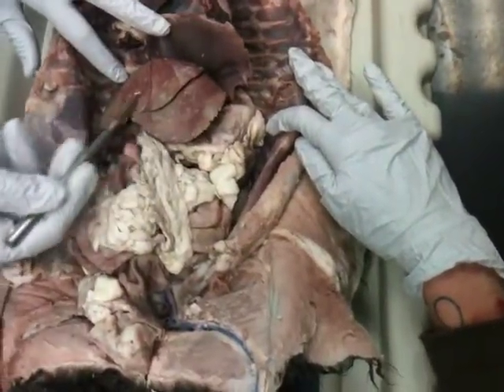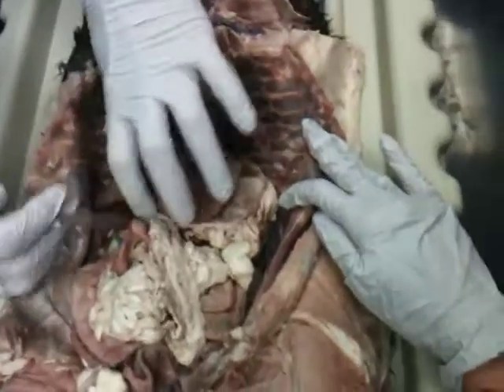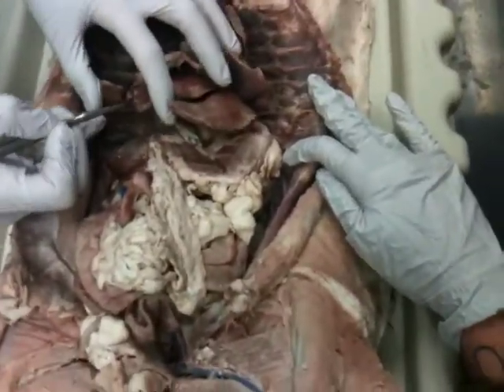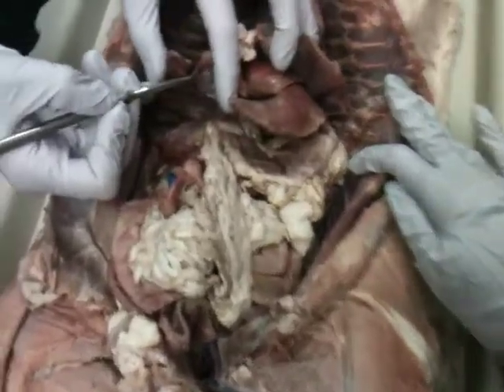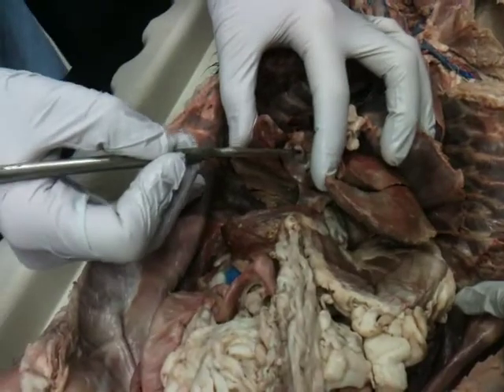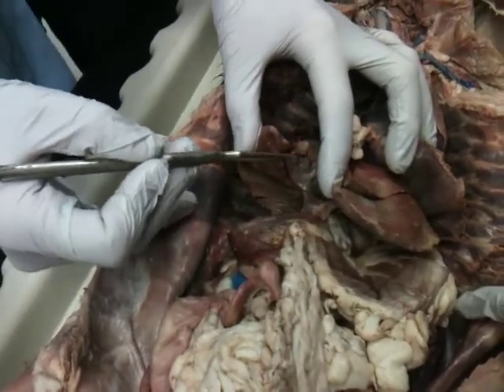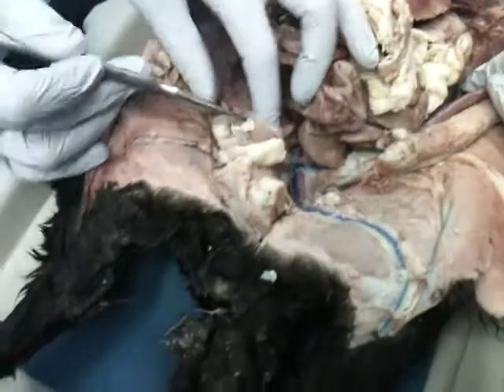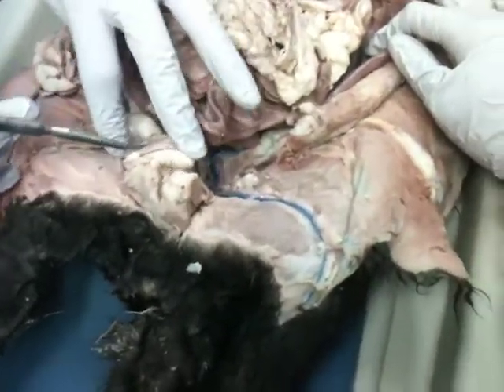We have the liver. A whole separate organ is the gallbladder that's in here. Usually it's a little darker in color because of the bile that's in it, but there's a gallbladder. You do have to differentiate the gallbladder from this one down here. What's that one? Urinary bladder. So if this were the question, you have to say urinary bladder, gallbladder.